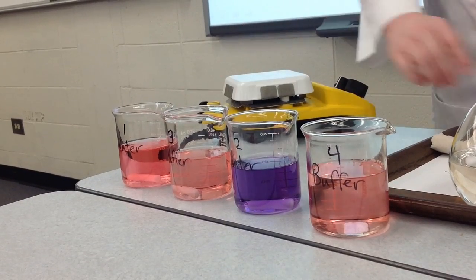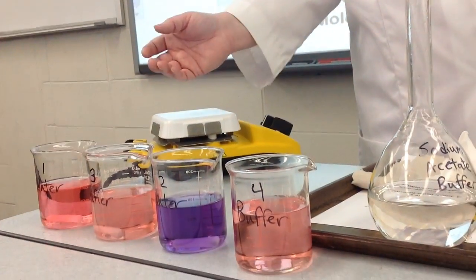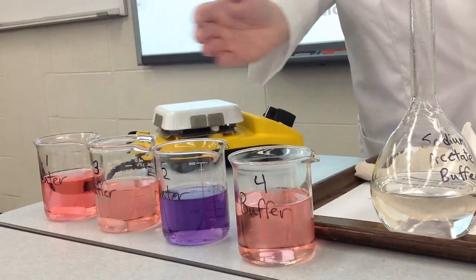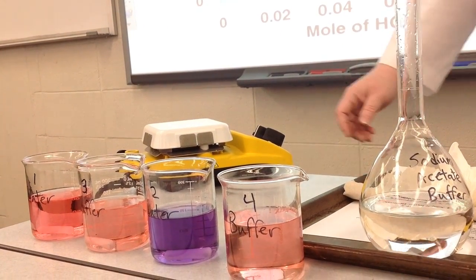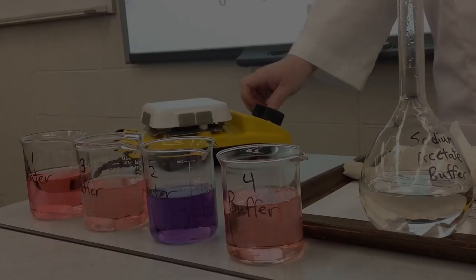But with distilled water, adding a very small amount of HCl or sodium hydroxide, we did see a very large change in pH.